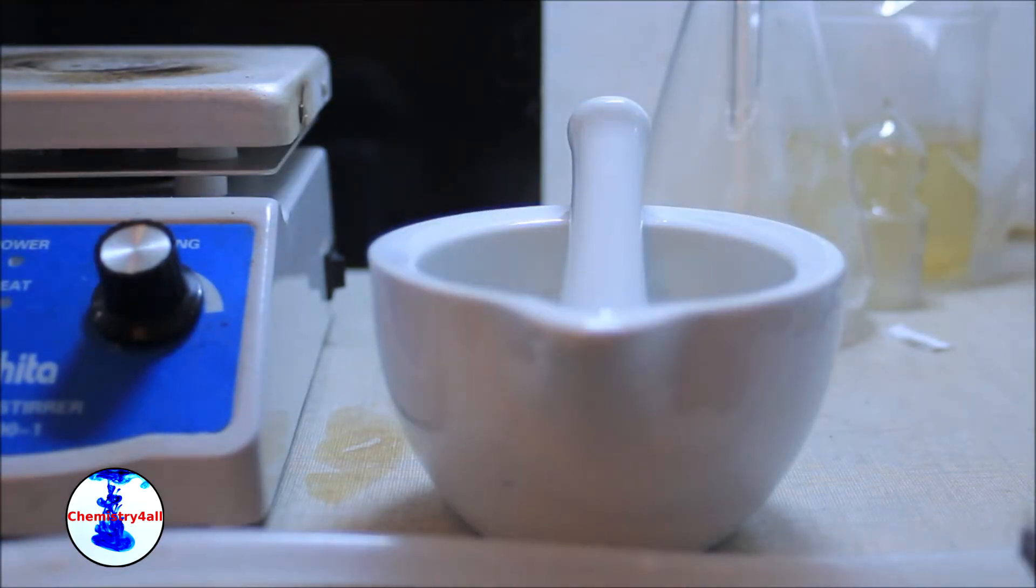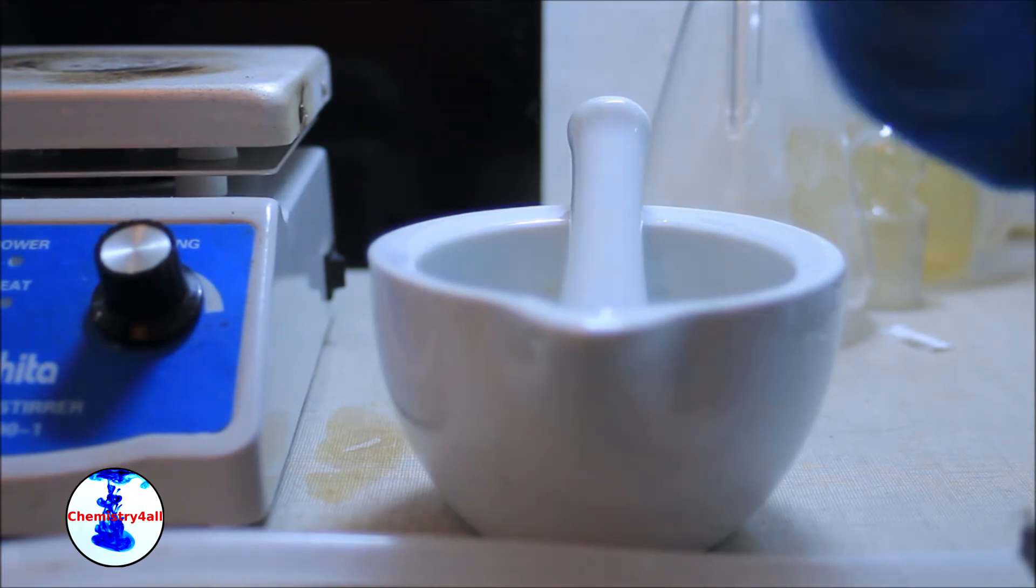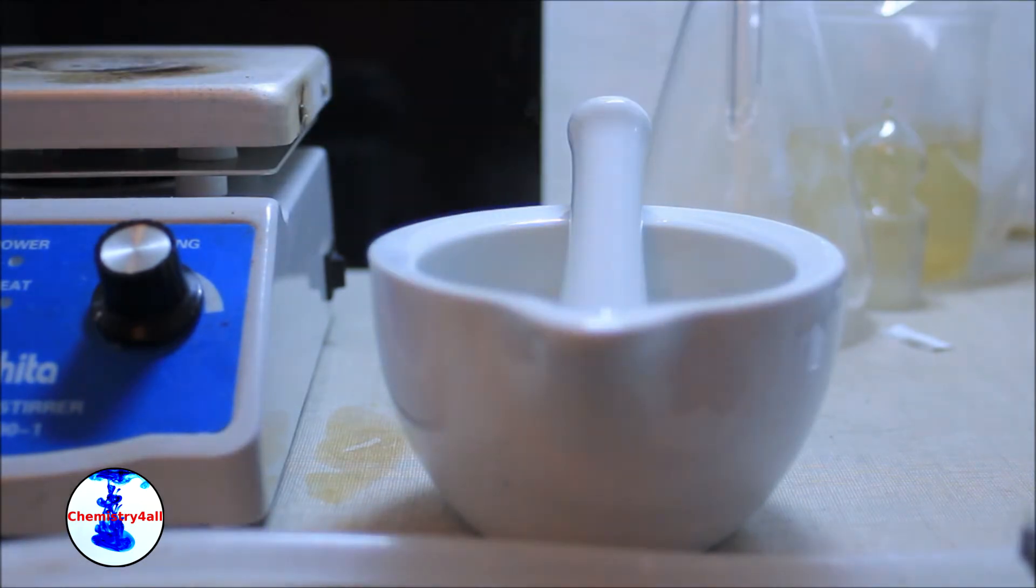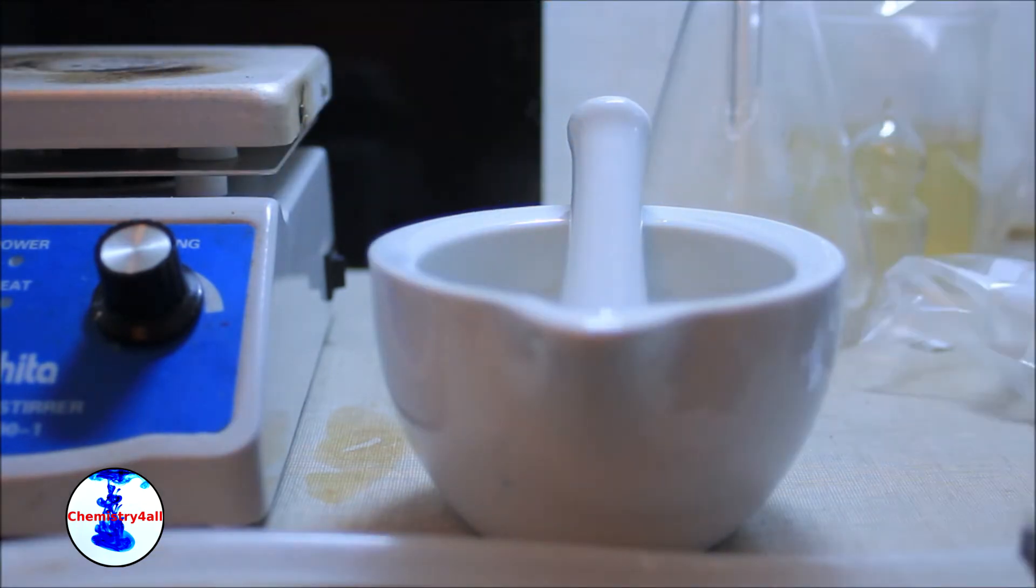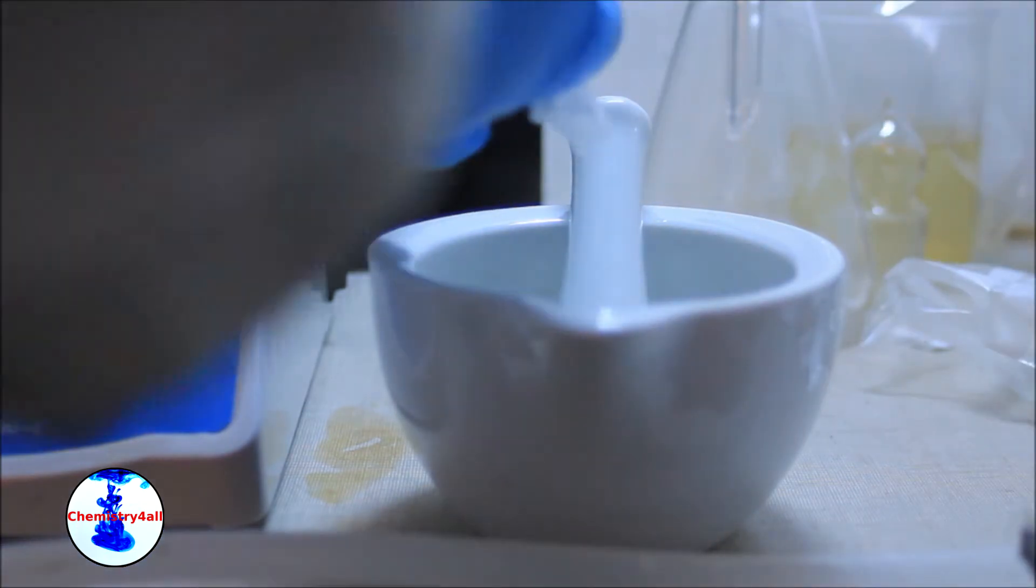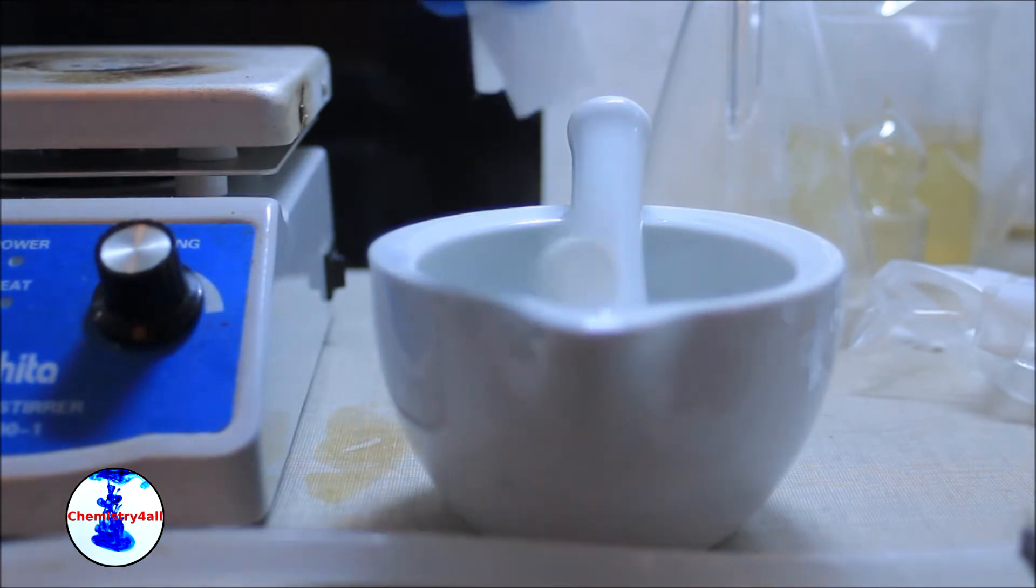First, the solid pills are ground using a mortar and a pestle. In my case this is optional as these pellets are designed with a lot of tiny holes, which helps the geraniol to diffuse during the extraction.